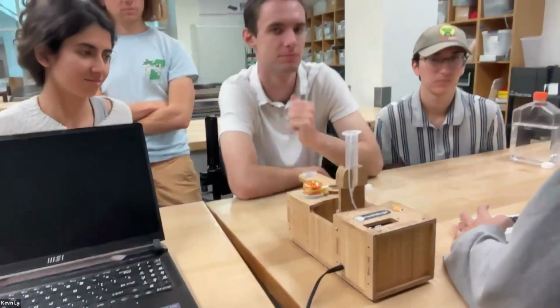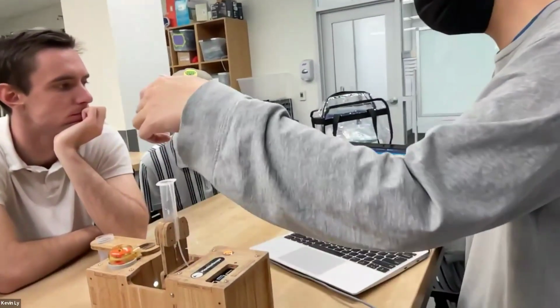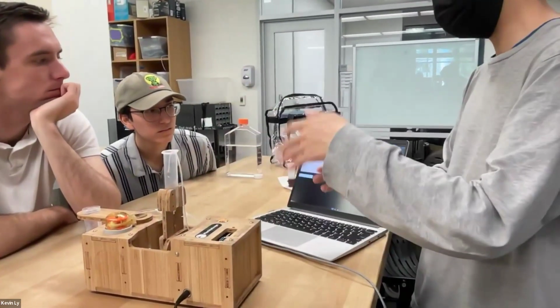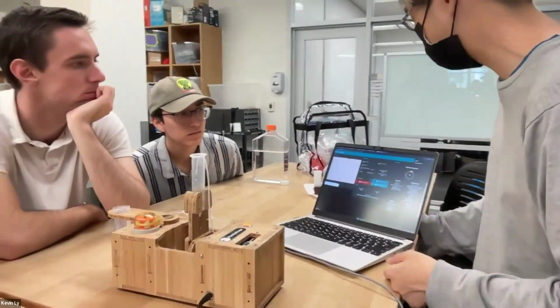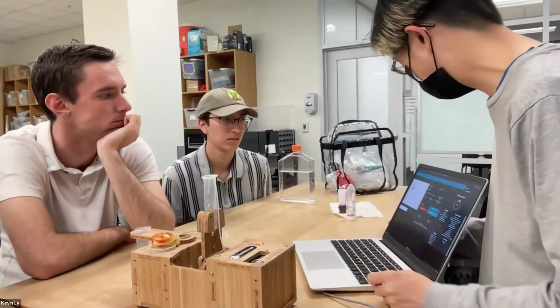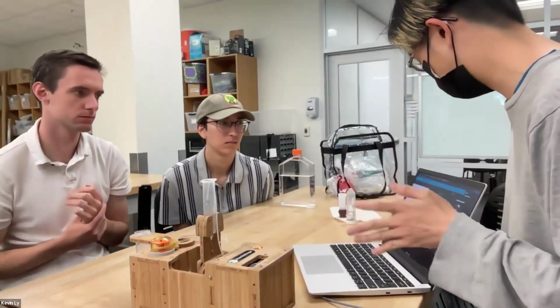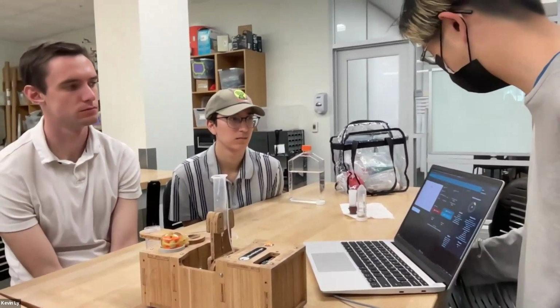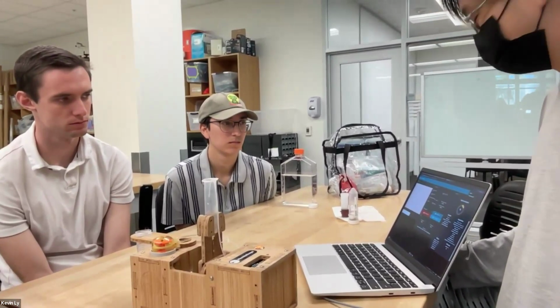Okay, so now I'm starting data acquisition. What it does is have the pump pull some fluid, stop, and then take an image. Then pump some more fluid, stop, take an image, and so on. So here we're really only imaging maybe 10% of the particles in the sample. But this is how we get nice high resolution images that are not so blurry, because things usually don't move around, although sometimes things are swimming, as you can see. So that's what we have right now.